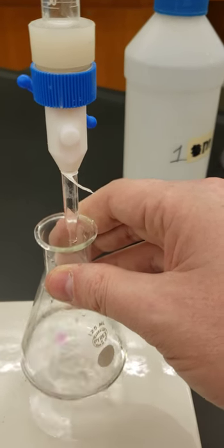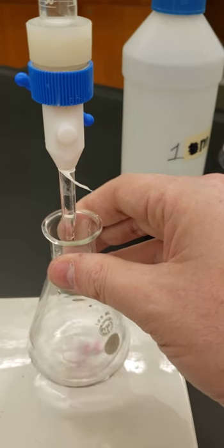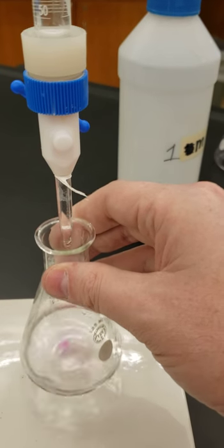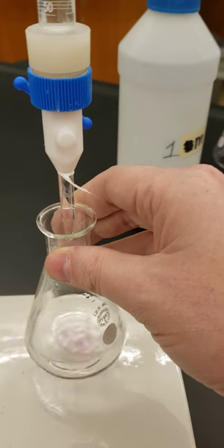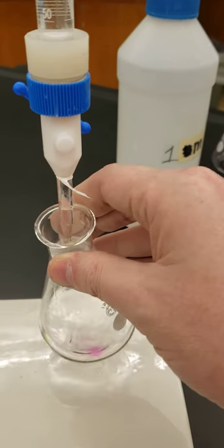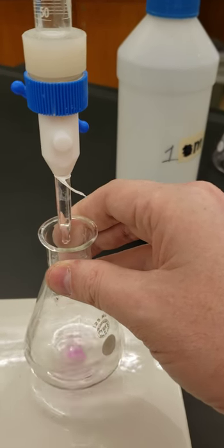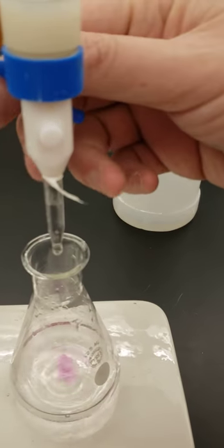See how the drops start to linger longer and longer in the system — that means we're getting closer and closer, and it's harder to dilute out. You want to be careful you don't hit the side of the beaker. Let's slow it down a bit.